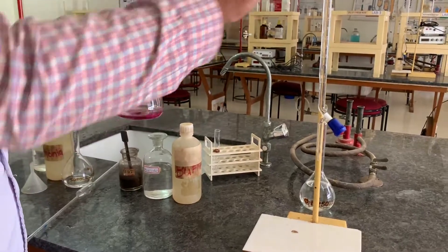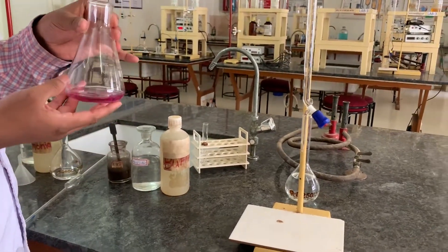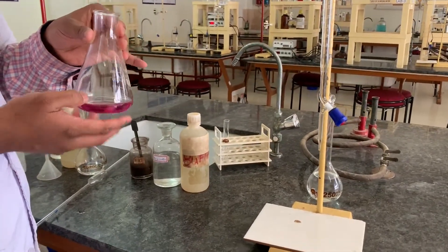Now we will start the titration against EDTA solution till the color changes from this wine red color into clear blue color.